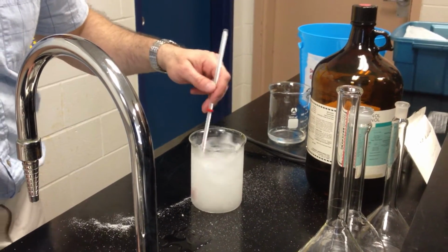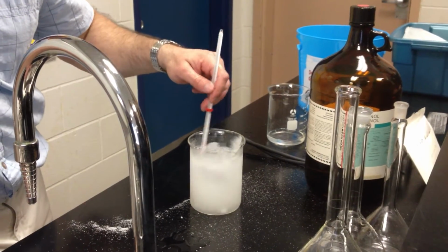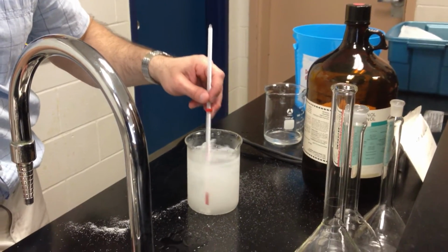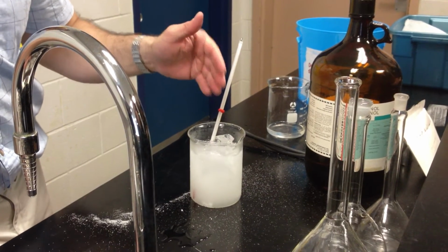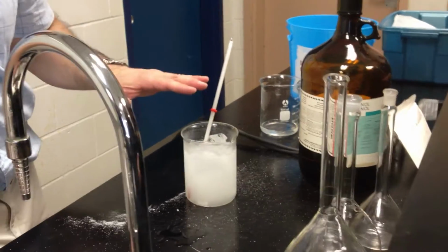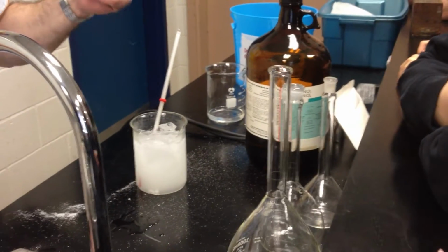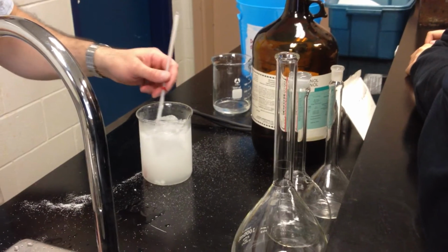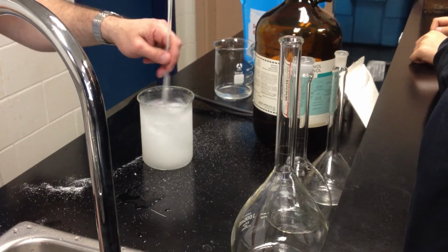And if the temperature goes below zero, the ice isn't going to melt anymore. So the presence of the ice was simply to ensure that the water temperature would be at least at zero. Because whenever there's a phase change going on, if you have a mixture of two phases of the same substance, you get an arrest in the temperature change. So water will warm up to zero if it's ice, and then while it's melting, the breakage of the bonds in the ice helps soak up the extra heat energy. So melting ice water will stay at 0 degrees Celsius until all of the ice has melted.